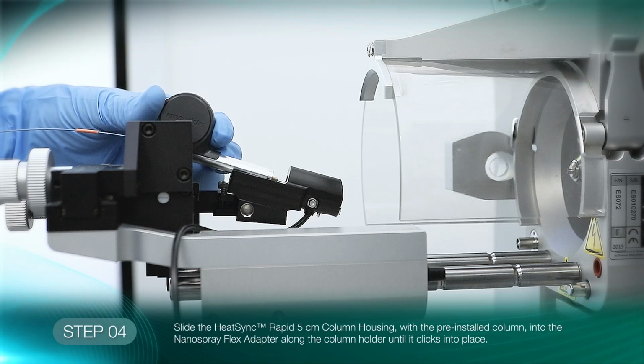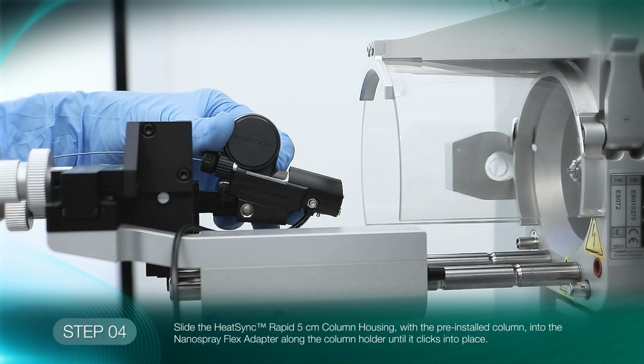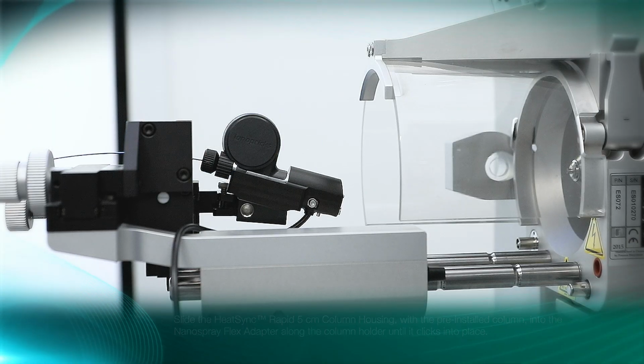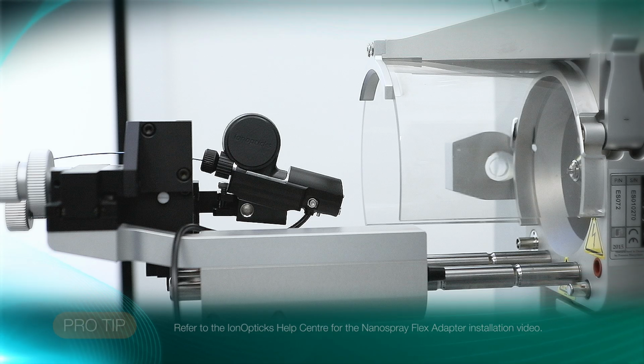Slide the HeatSync housing into the pre-installed Nanospray Flex adapter along the column holder until it clicks into place. For instructions on how to install the Nanospray Flex adapter onto the source stage, refer to the separate installation video in the IonOpticks Help Center.